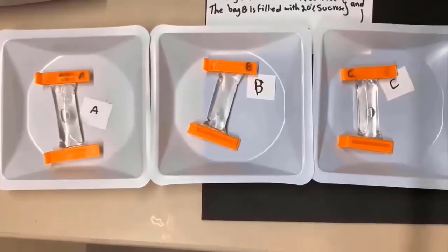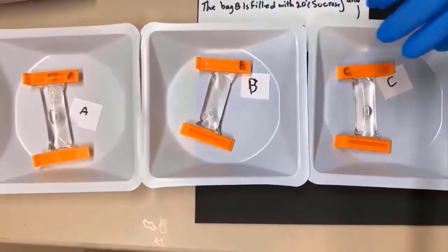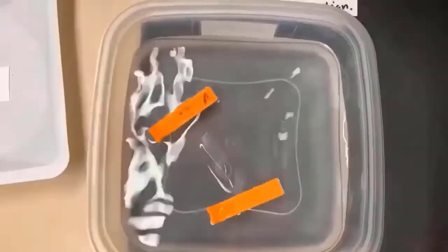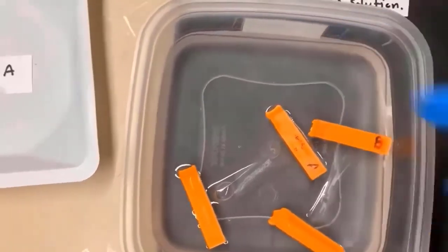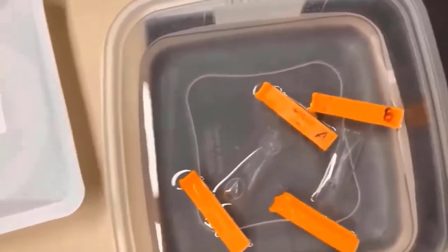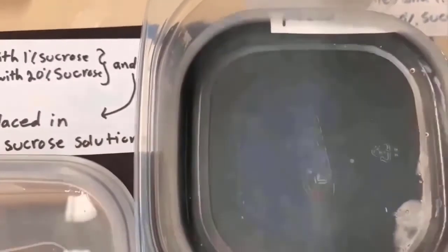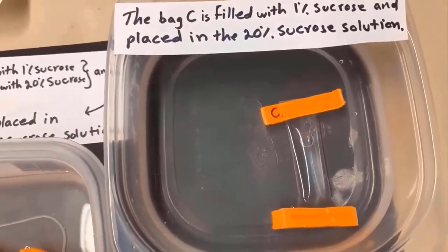Before I immerse them in the sucrose solutions, I want you to pay attention to the appearance of these bags. Now I am going to place bag A and bag B into the 1% sucrose solution. The solution should cover the bags — I am going to add 50 milliliters more to the outside solution. At the same time, I am going to immerse bag C into 20% sucrose. So bag C is filled with 1% sucrose and placed in 20% sucrose solution. I am going to check it after one hour.